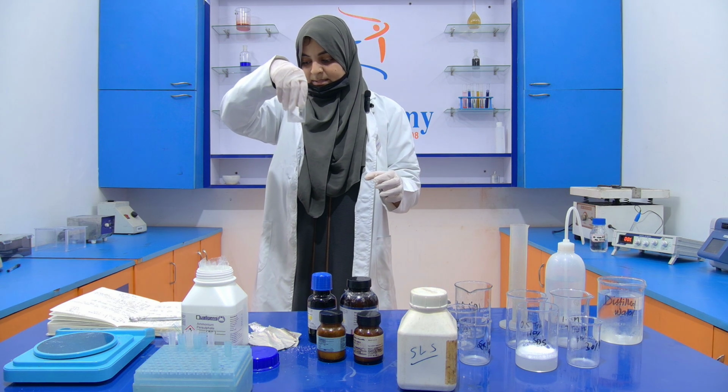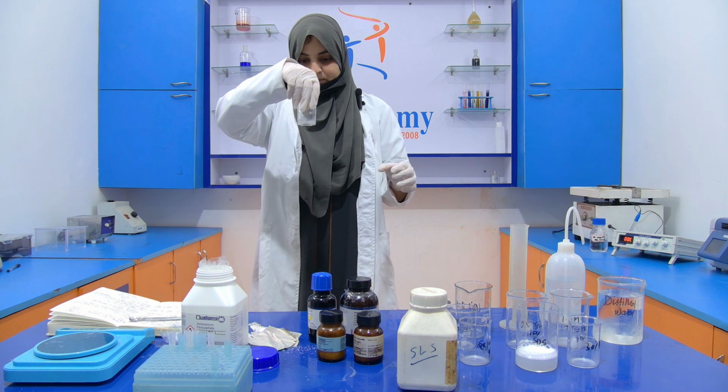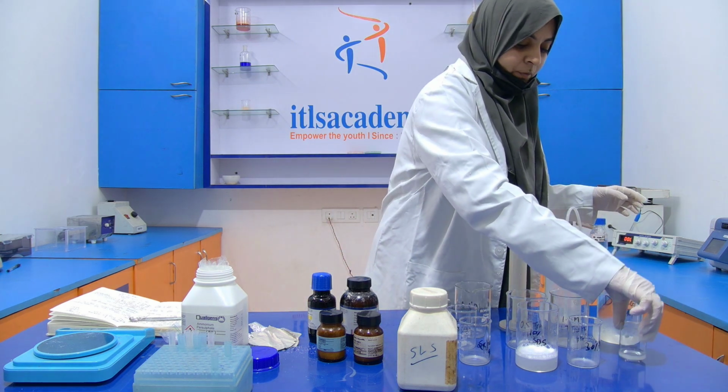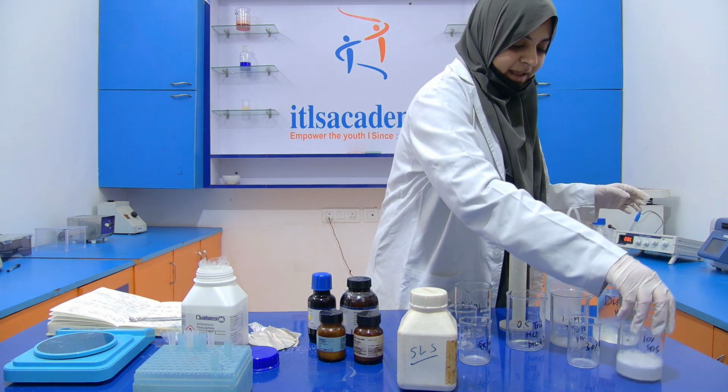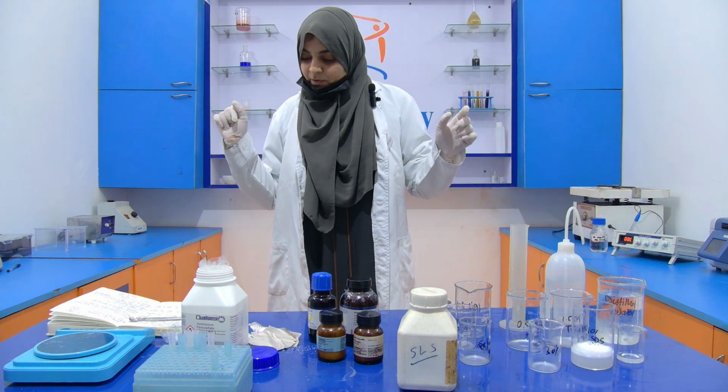Now this is 10% APS. So we have prepared two chemicals: one is your 10% SDS and one is your 10% APS.